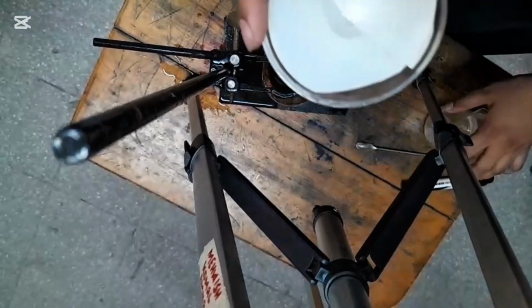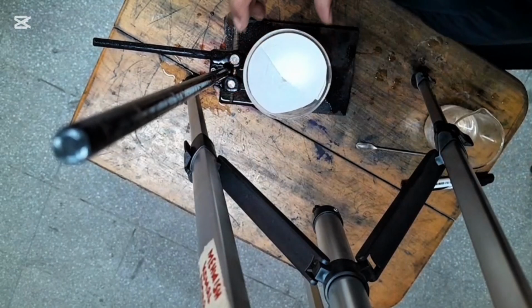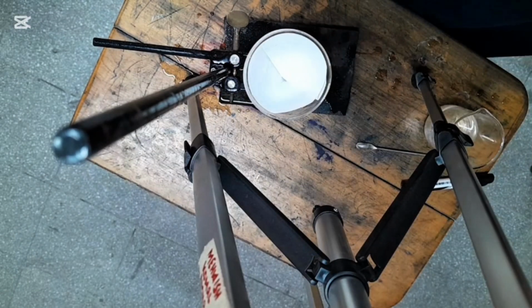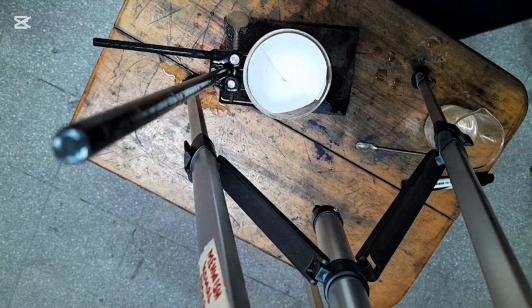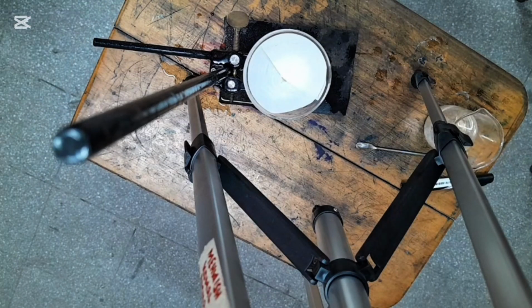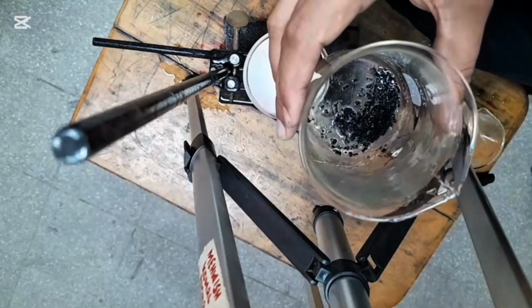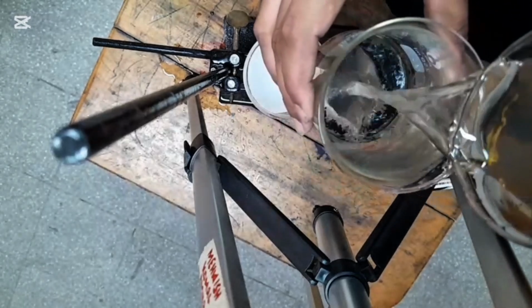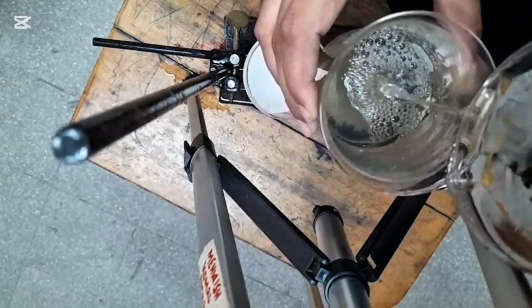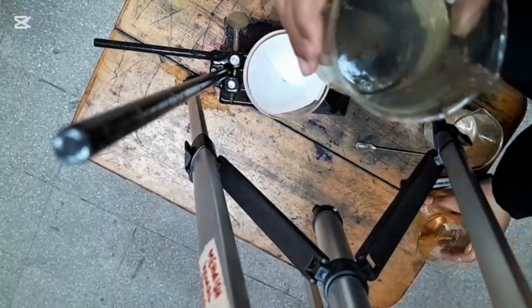Next we will do the experiment of the suspension, to see how a suspension is formed, and after the filtration of the suspension, whether we have anything left as a residue on the filter paper or not. Okay, so I am going to start forming a suspension. You can see that these are sand particles. I am mixing these sand particles with the water, which acts like a solvent, and you can see I have started making a suspension of both of them.